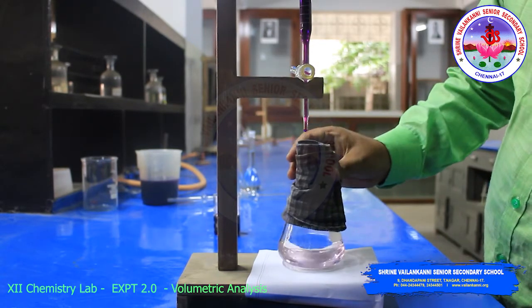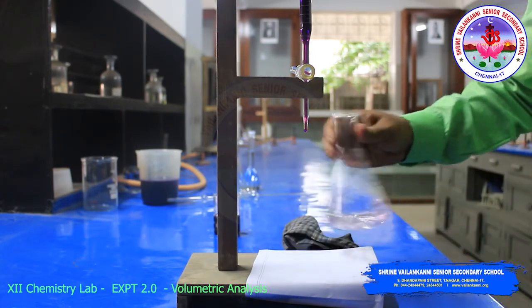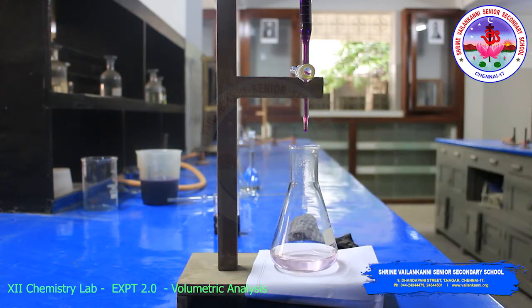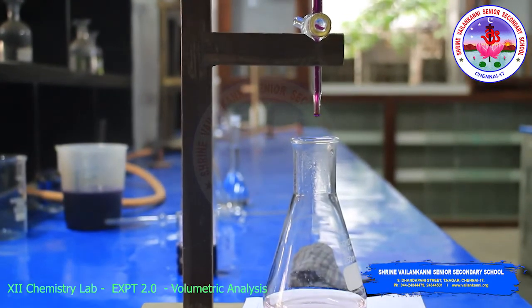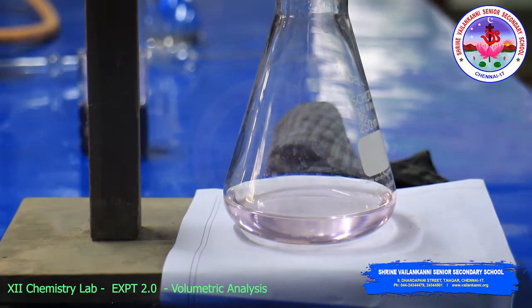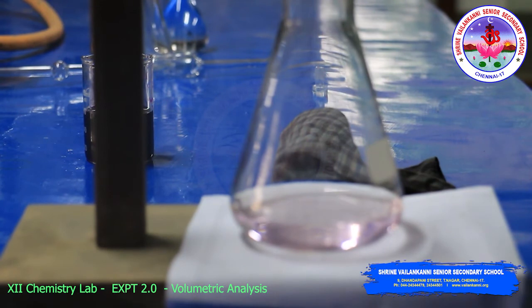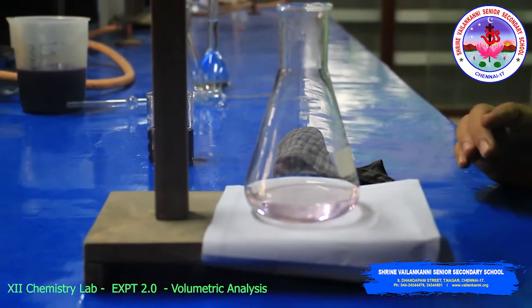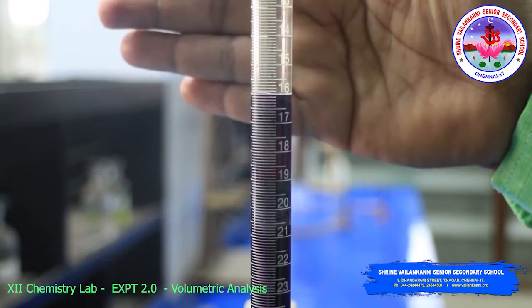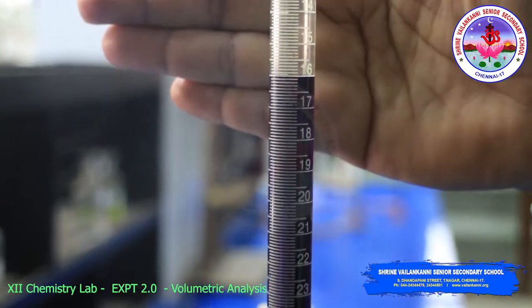See, this is permanent pale pink color. The permanent pale pink color has appeared. Can you see here? So the titrations are over. Now you can see the value, that is the scale of the burette reading. Here 16 is shown, you can see. Now can you see the value? Here the 16, exactly 16.